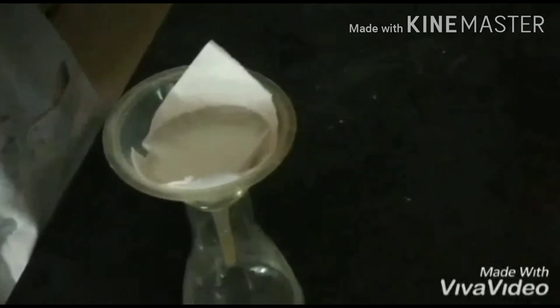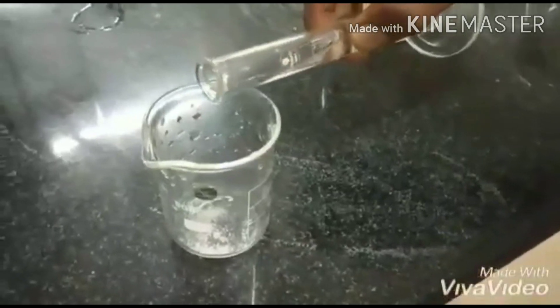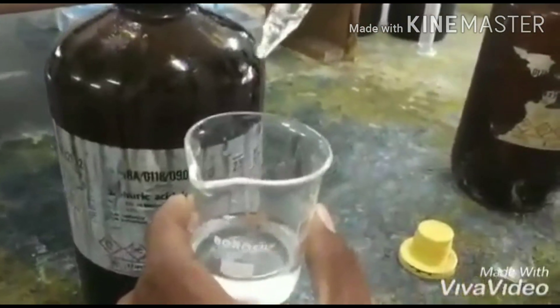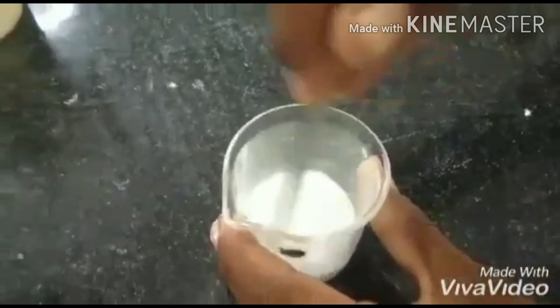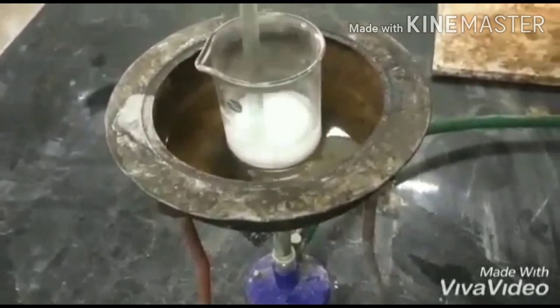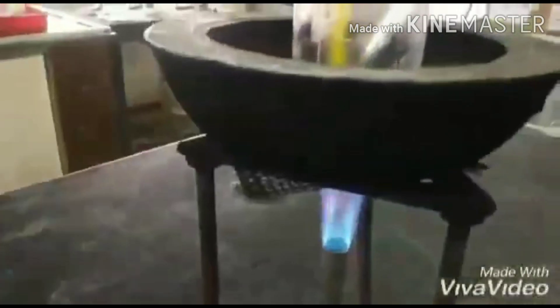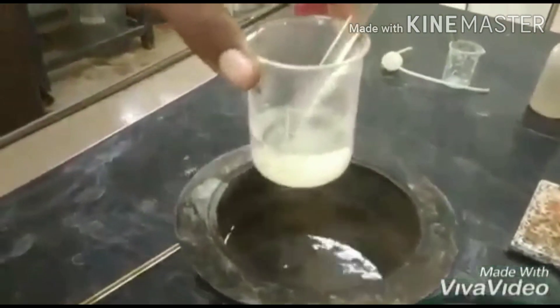The crystals are then recrystallized from a thiourea solution — 0.1 gram of thiourea in 30 ml of distilled water — with about 5 drops of concentrated sulfuric acid added and mixed well. The mixture is heated in a water bath for a few minutes until the temperature reaches 75 degrees Celsius.